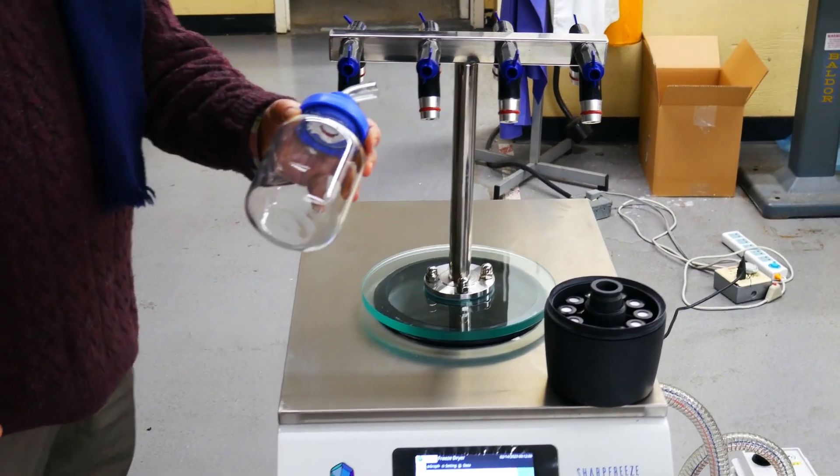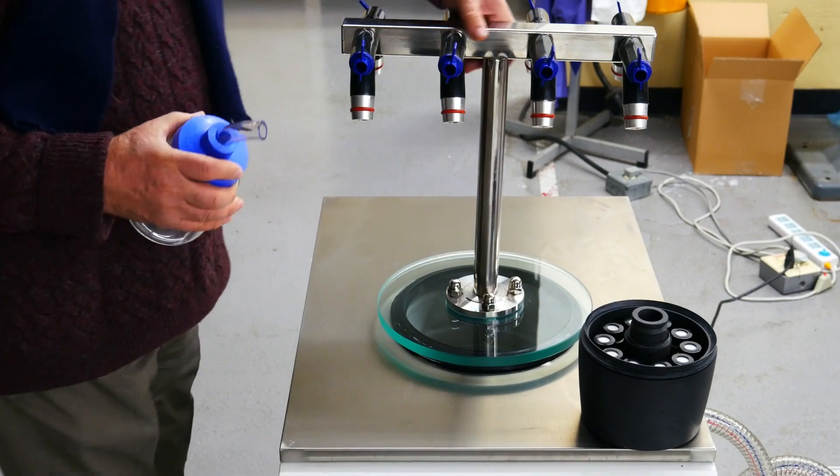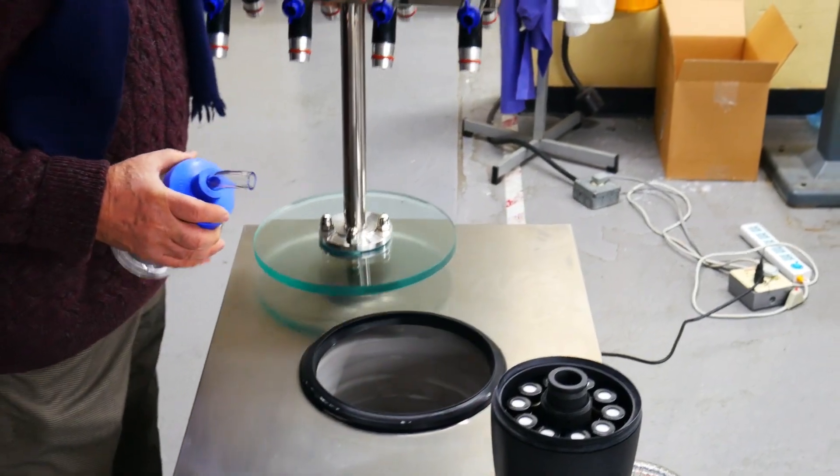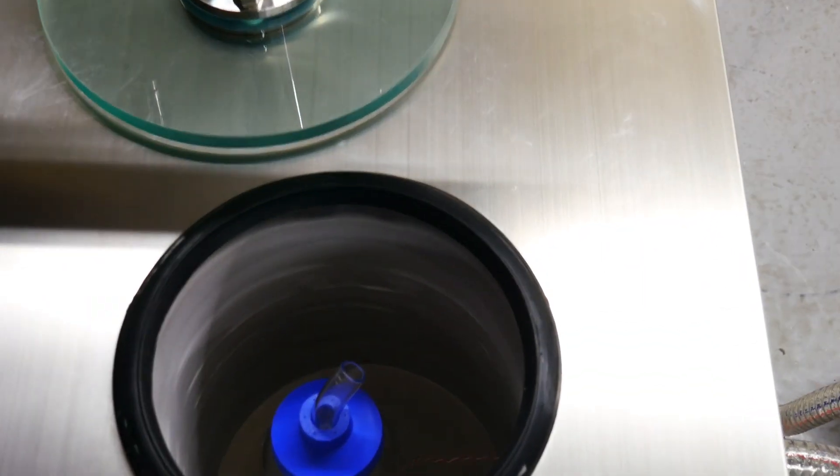It really doesn't matter if you have a flask. If you have a flask, you put your liquid inside, take this off, put your sample inside, and in 10 minutes, the sample is frozen.